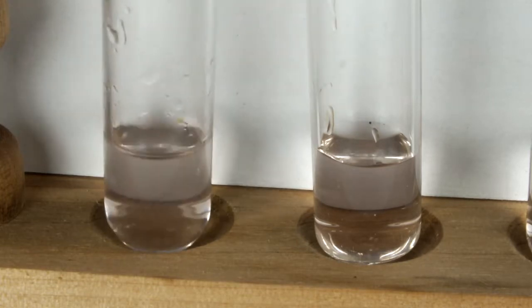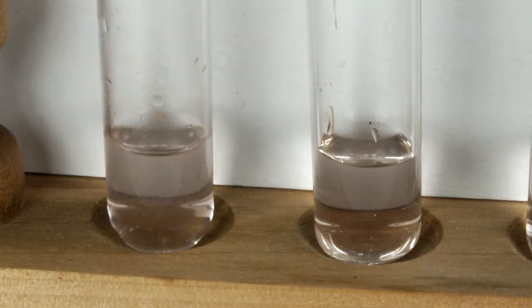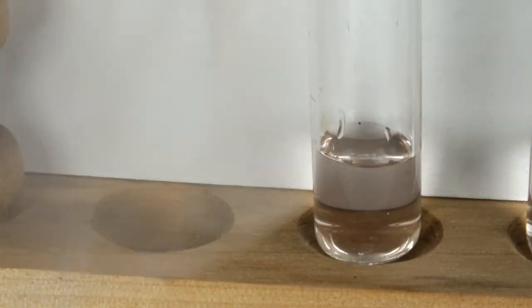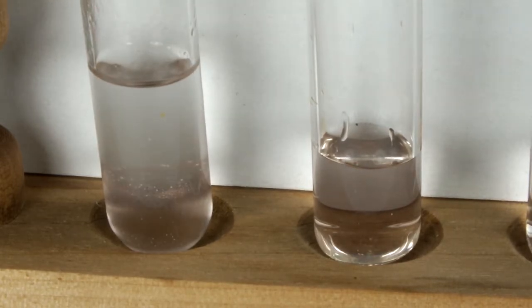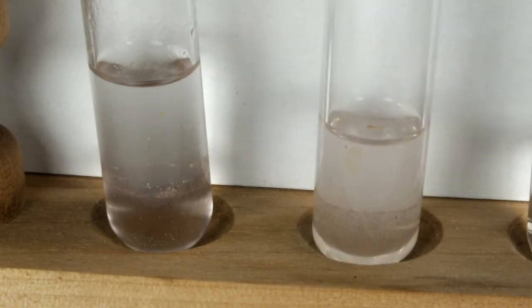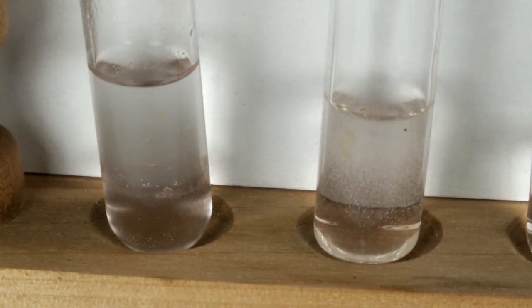I didn't want to add too much ethanol, because I don't really want to overwhelm the system. After mixing it up some, I did notice what I thought to be fine solids. Then I went for broke and added a whole bunch of ethanol. I suspected the rest of the salt would crash out, and I'd eventually be left with diluted alcohol and a pile of manganese sulfate. Next up, I tried another solvent. Once again, I started with a small volume, and I declared this to be more obviously precipitating at the time of the experiment. But if you notice carefully, the solids are actually precipitating up.